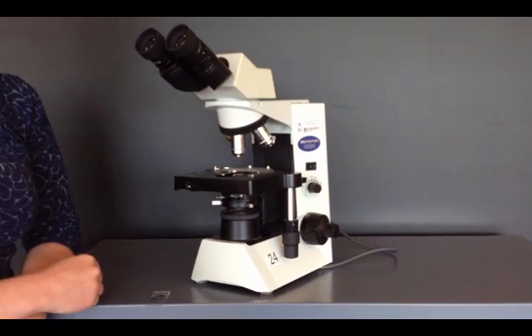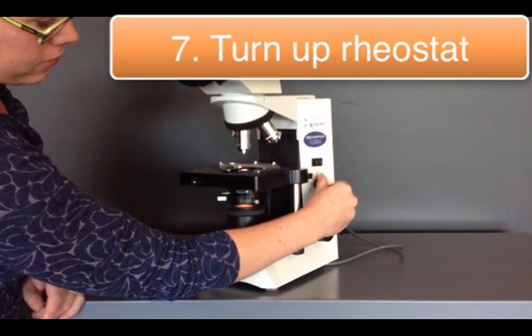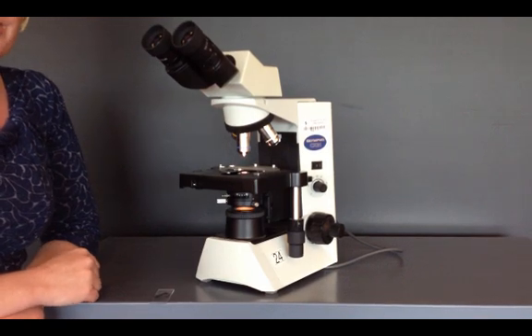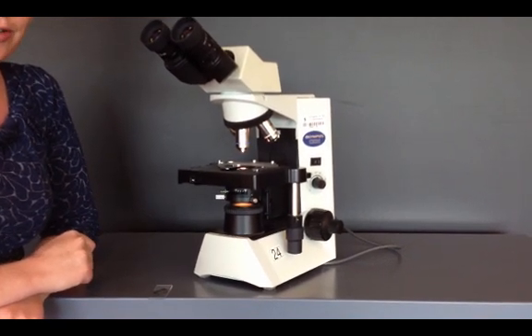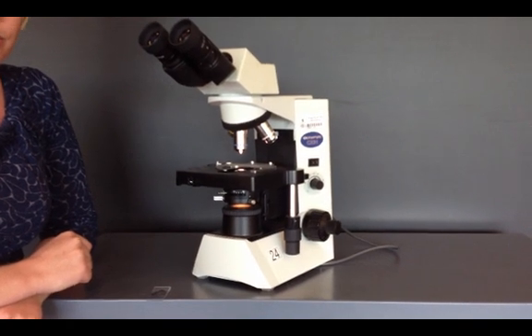Now you're going to turn your rheostat up to about 3.5. By turning it on with the rheostat all the way down at first, it allowed the bulb to warm up before we turned it up to 3.5.